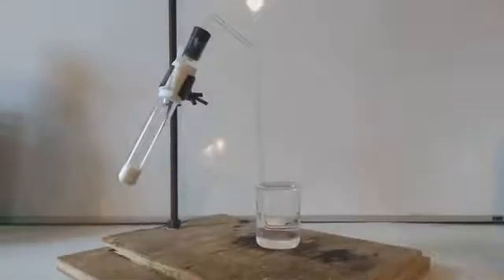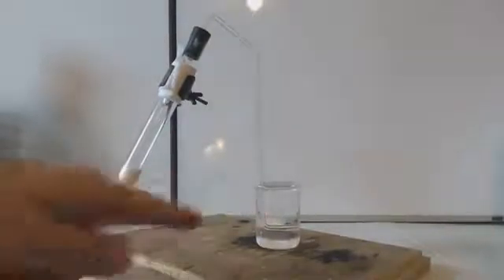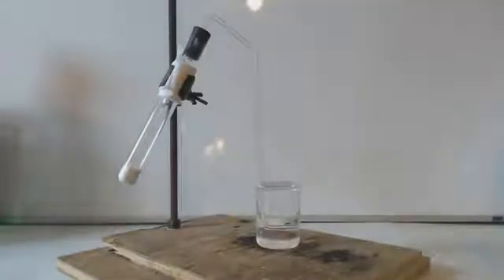I want you to see inside the test tube - I have baking soda or sodium bicarbonate. In this thing here I have a saturated solution of calcium hydroxide, and this is how you test for carbon dioxide by the way. I'm going to heat this up and it's going to release carbon dioxide into there. If I had potassium hydroxide in there and I bubble this CO2, it's the same as the atmosphere bubbling it in, but I'm doing it at a faster rate.